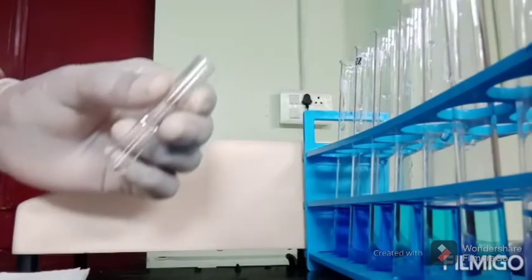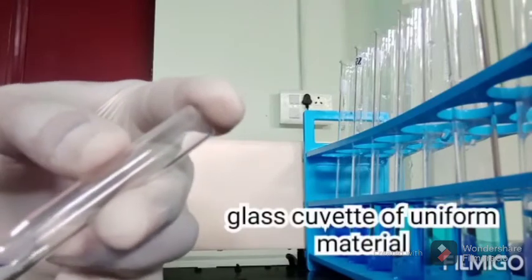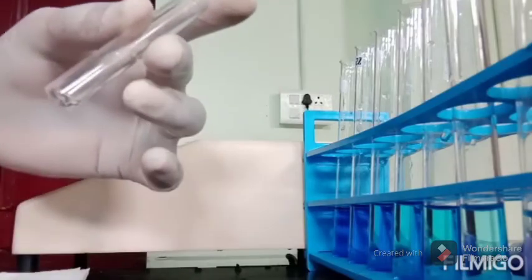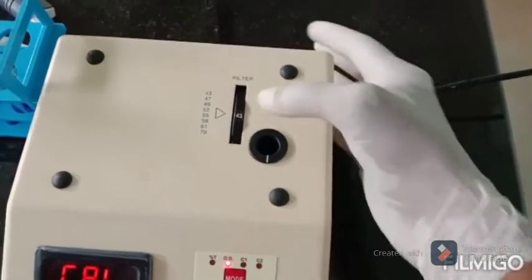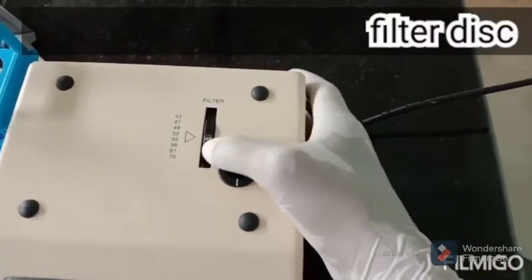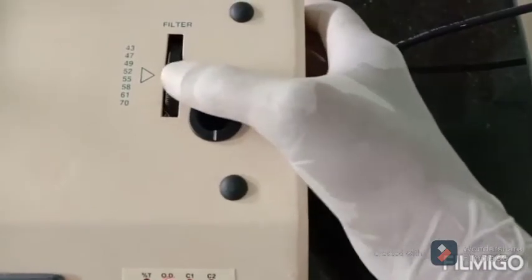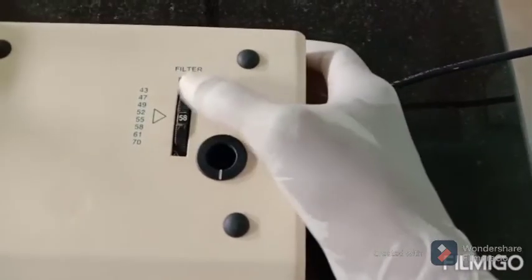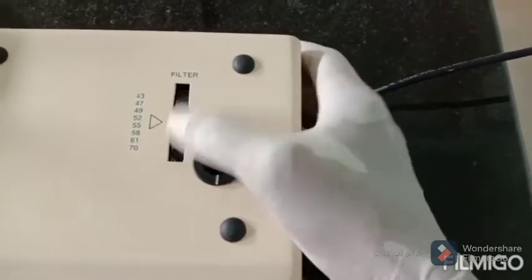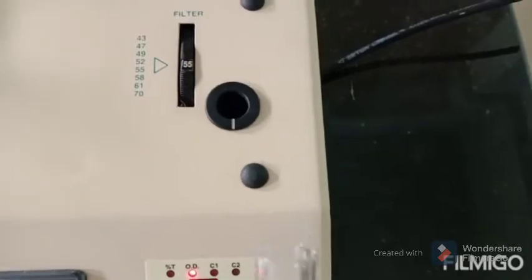This is a cuvette made of glass of uniform material, and it will have a marking on it, which should coincide with the marking on the cuvette holder of colorimeter. And before measurement, an appropriate filter is to be chosen from the filter disc of colorimeter. Typical range of wavelength used in standard colorimeter is 420 to 710 nanometers, ranging from blue to red in visible light. That is, 420 around is violet blue, and red is around 710 nanometers.